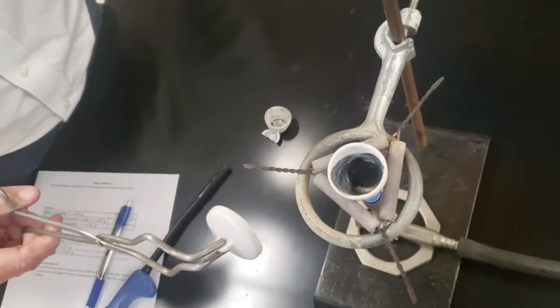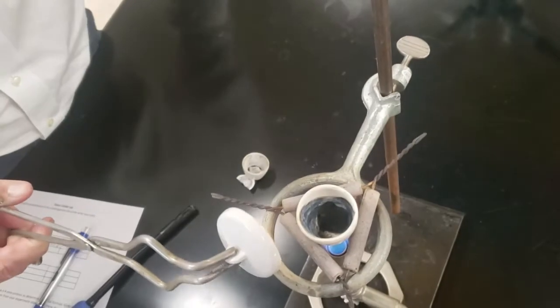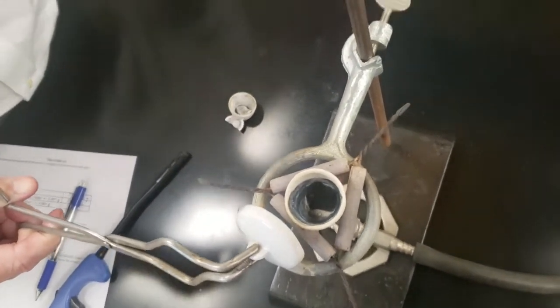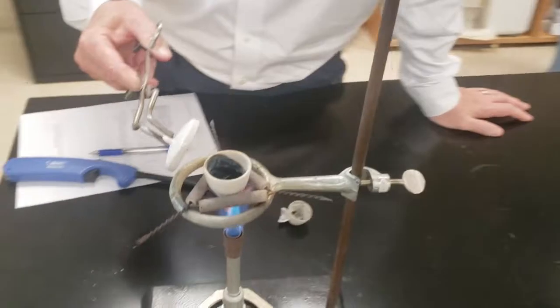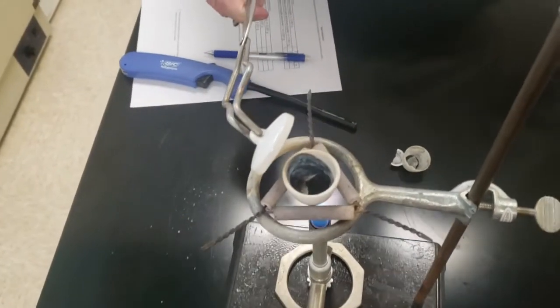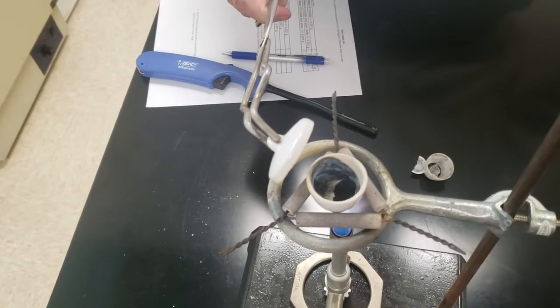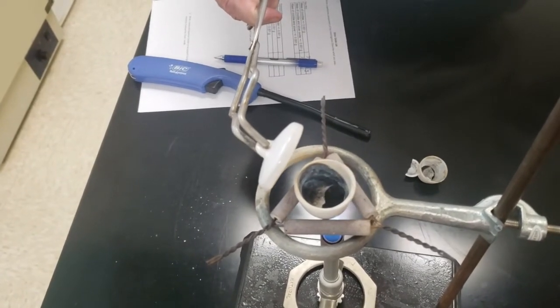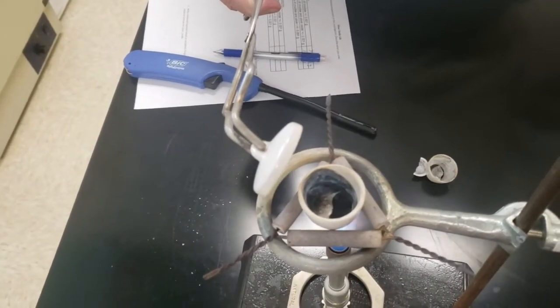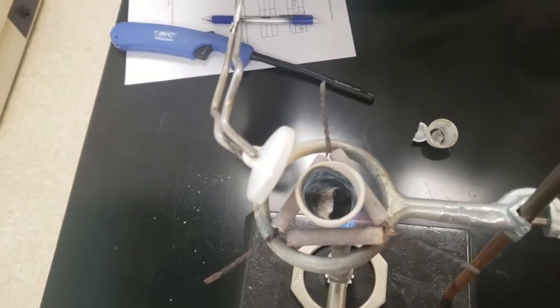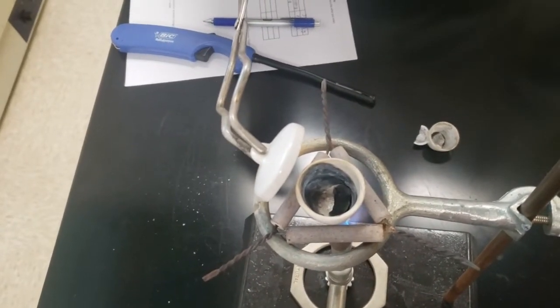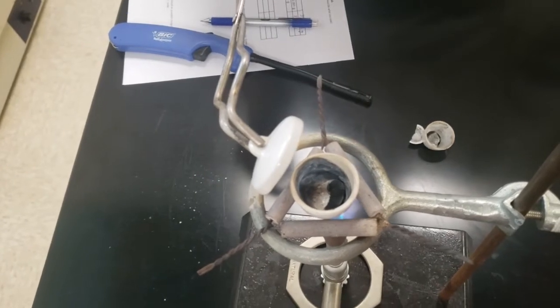As we get it heating up, we're going to go ahead and put the top on it at some point, because we're going to heat it, heat it, heat it. We want to drive away the oxygen from the silver oxide. And if you don't heat it completely and have it completely decompose, well, your numbers will show.